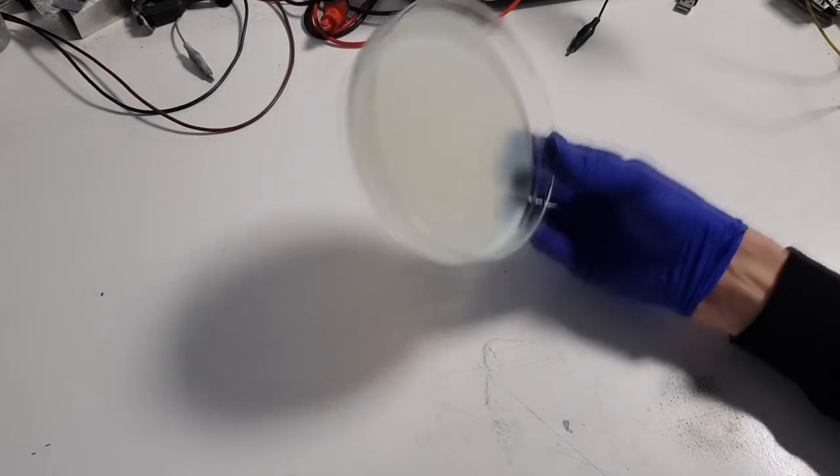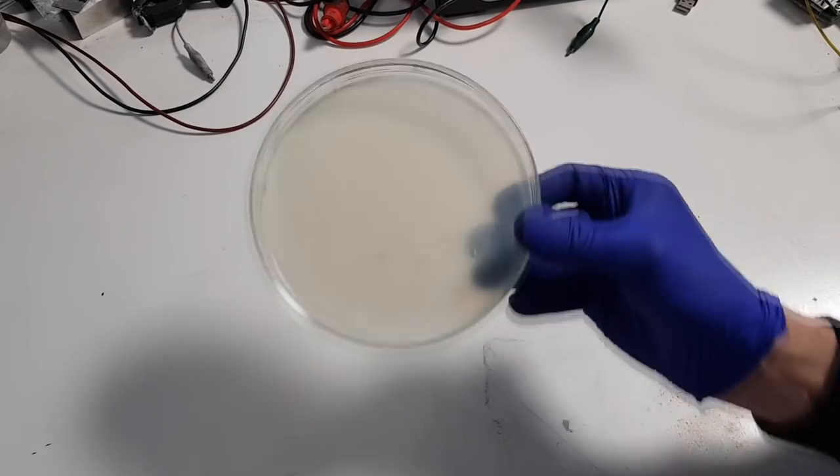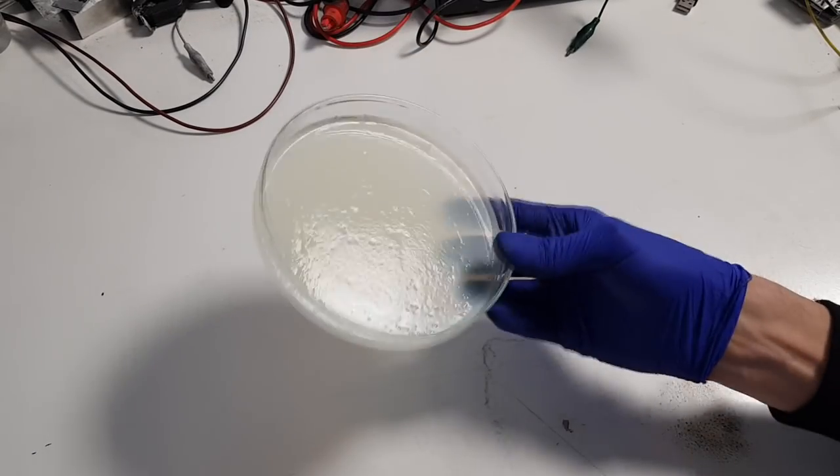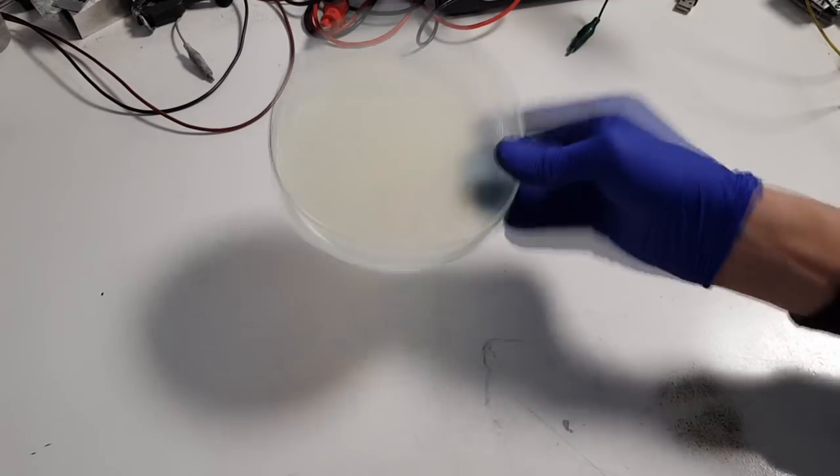So guys, when this electrolyte is dry, you get this, some polymer gel electrolyte.